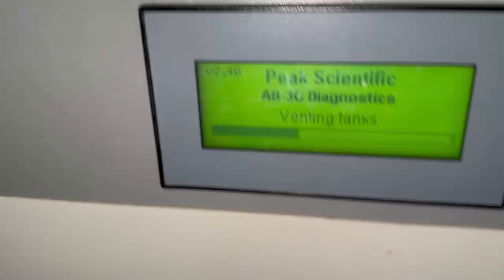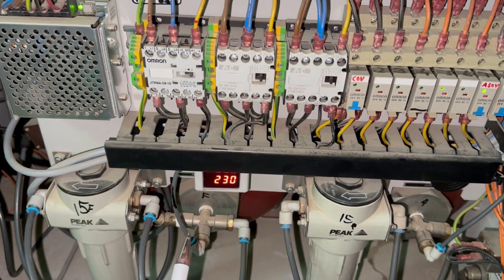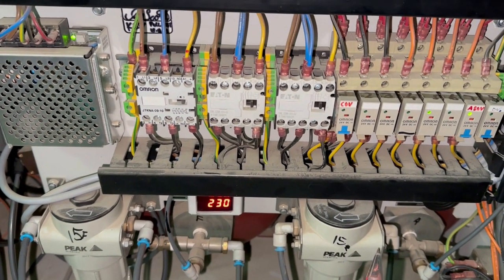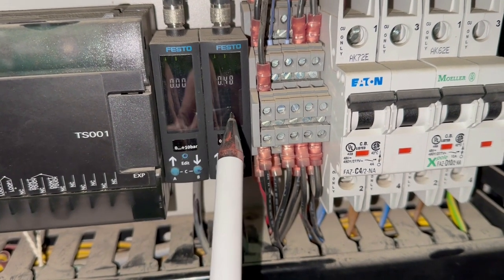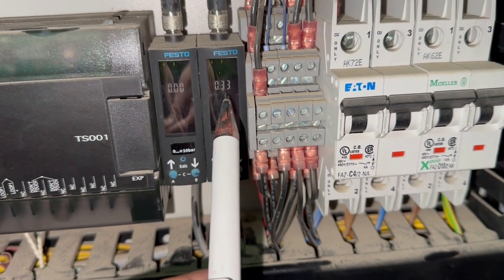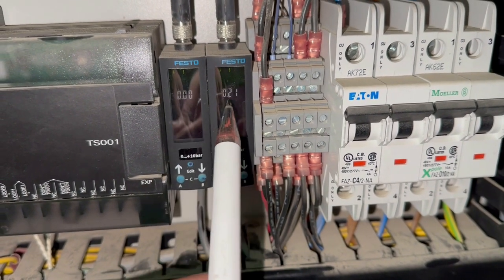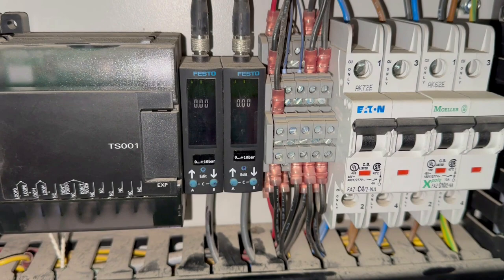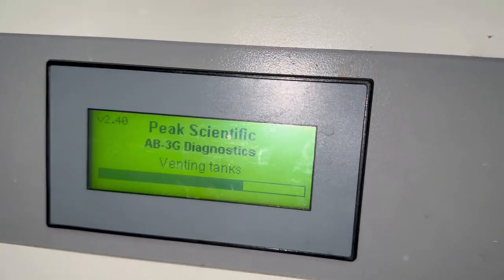So venting. As I already mentioned, we have 2 tanks, one for the nitrogen, and the second one is for air. And here we have 2 pressure switches. The first one is for the nitrogen and the second one is for the air. Since it's venting, you can see the pressure is decreasing. Once it's completely vented, it will switch on again. So now it's 0. It's venting tanks. Maybe it's time based.